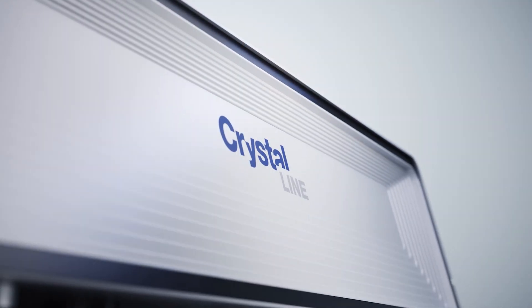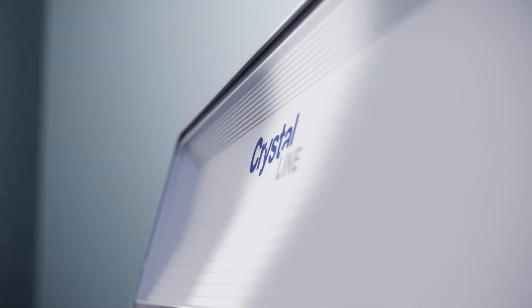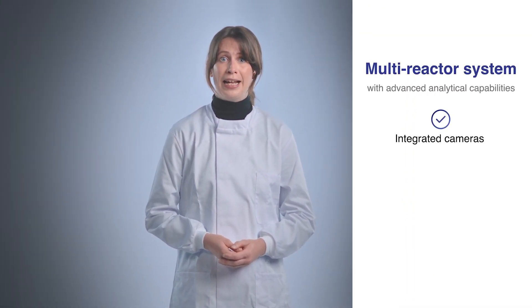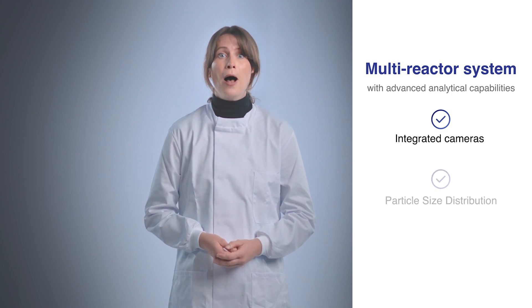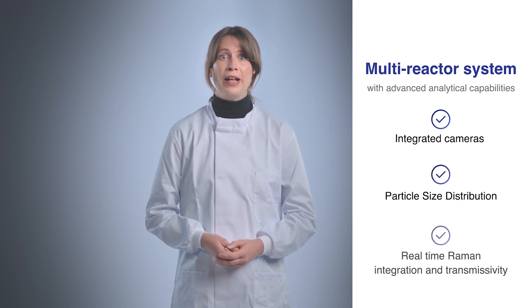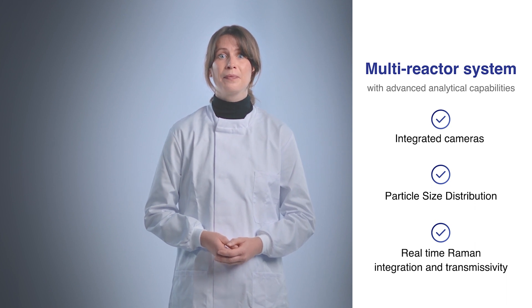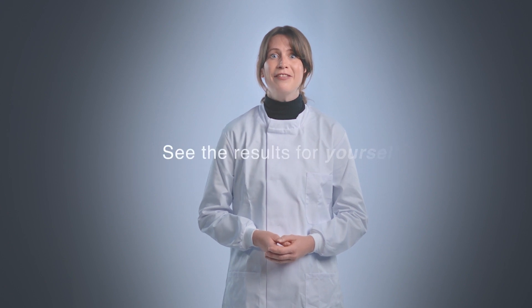The re-engineering of the reactors takes temperature control, accuracy, and stability to the next level. The benchtop multi-reactor system incorporates advanced analytical capabilities through the vial, such as integrated cameras for particle imaging and analysis, particle size distribution, real-time Raman integration, and transmissivity. Take the guesswork out of crystallization studies and see the results for yourself with the Crystalline version 2.